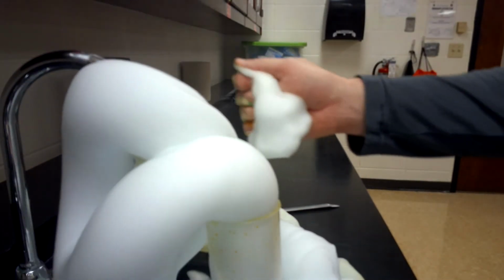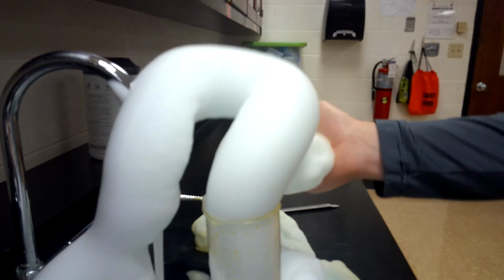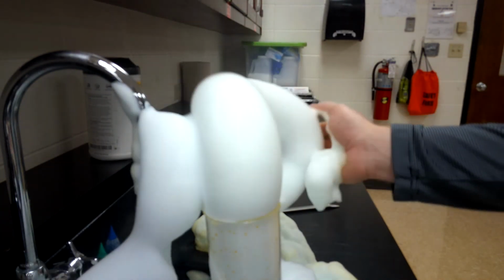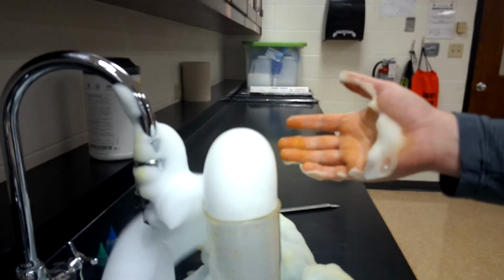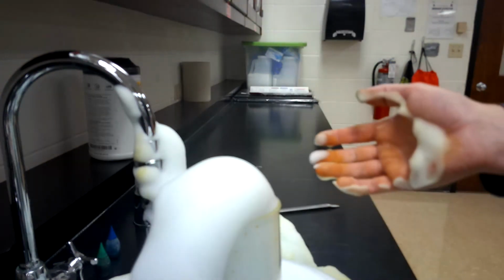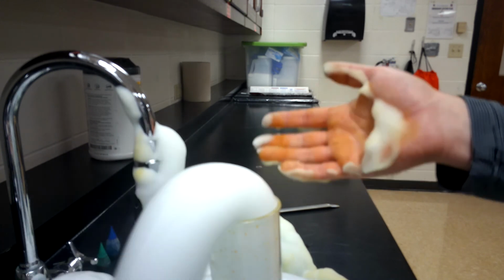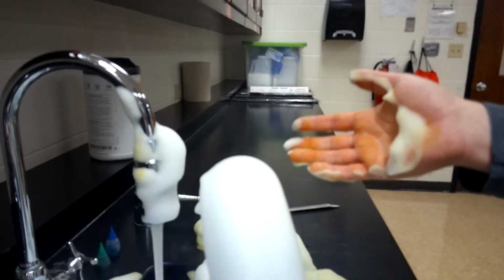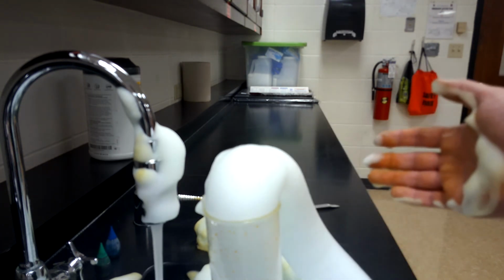It's going to keep going, like I said, until the hydrogen peroxide runs out or until the soap bubbles run out. It just keeps going and going and going. And that's with only doing one thing. I didn't do any of those other factors. Imagine if I did all of the different factors at the same time, how cool of a reaction we could have. We could have this up to the ceiling in a hurry. So there's your factors affecting rate of reaction demonstration.